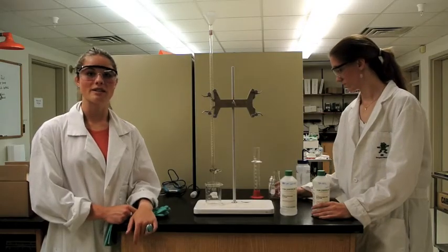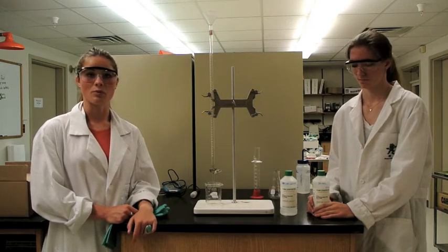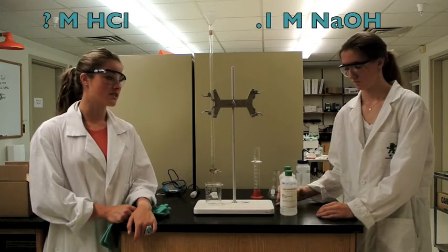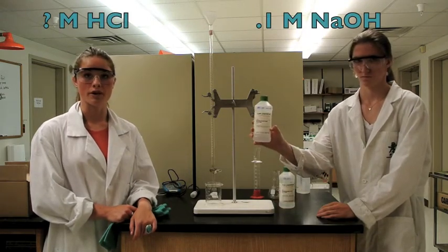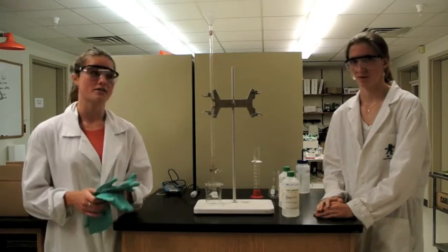So today we will be titrating a strong acid with a strong base. Our strong acid will be hydrochloric acid of unknown concentration, and our strong base will be sodium hydroxide of 0.1 molar. Before we begin, make sure to put on your rubber gloves, your goggles, and for fun, your lab coat.